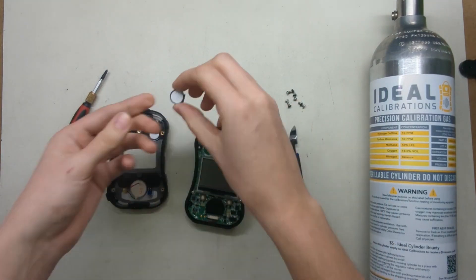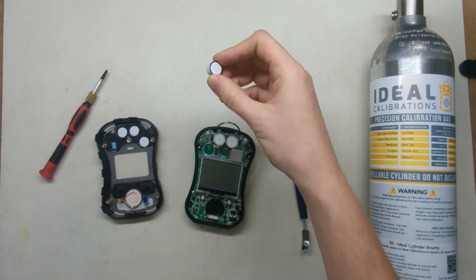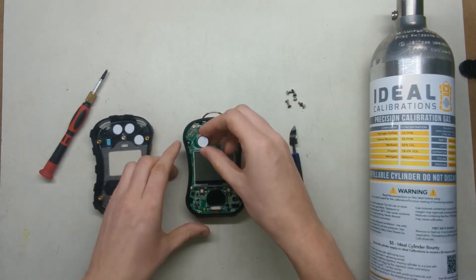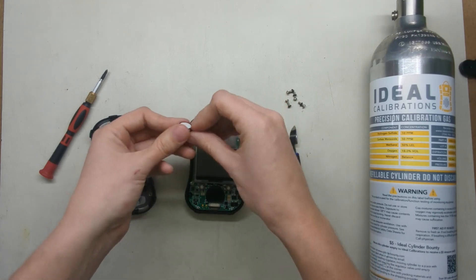You can put it aside. Now this is actually a new O2 that we're just going to put in here now. We're just doing it for demonstration. But you would put your old one aside. Record the serial number if you need to.